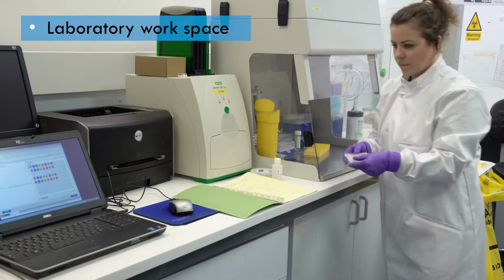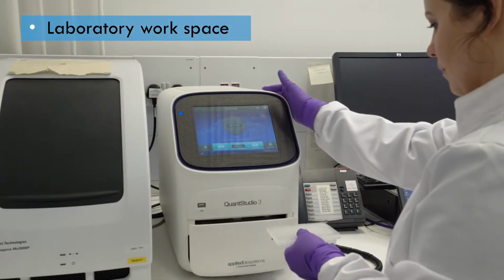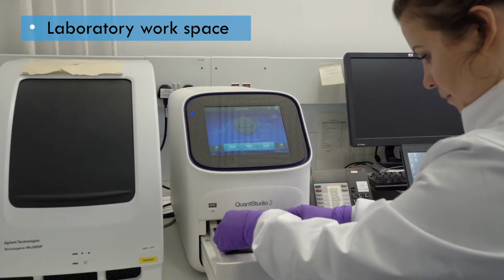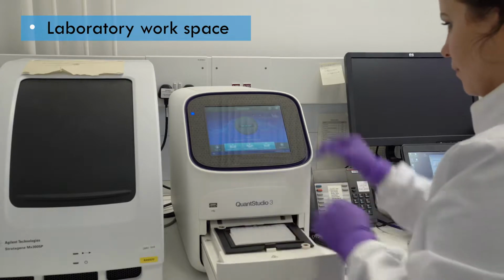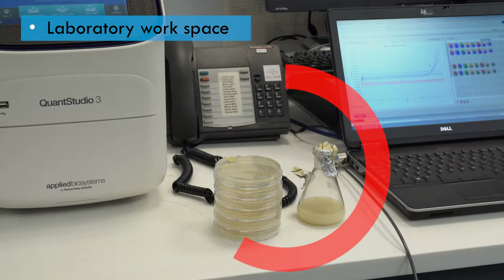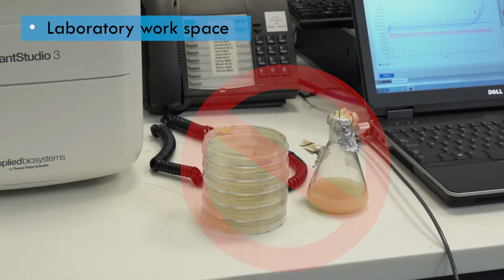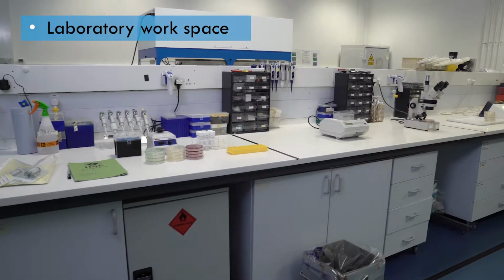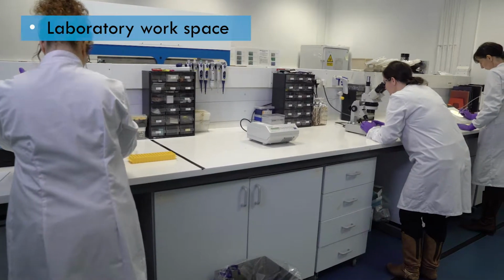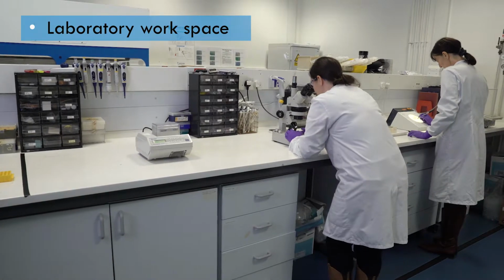It's important to note that different processing procedures can have adverse effects on each other. For example, the cultivation of live biological agents could contaminate samples being processed for PCR, potentially creating false positive results. So these types of processes should not be carried out in the same area. Within a laboratory, separation of conflicting activities may be achieved by having designated areas on workbenches. These could be marked out using tape and labelled.